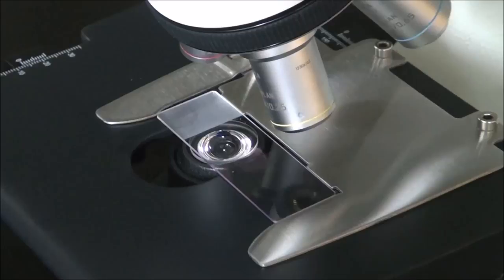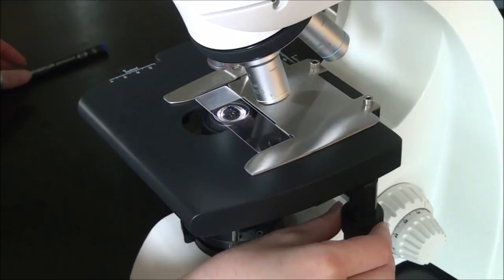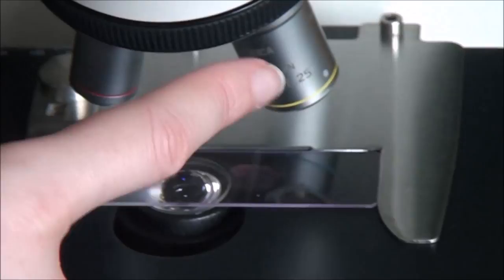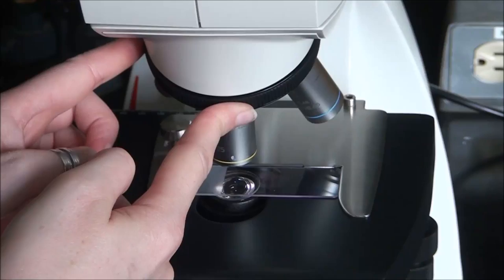Make an orientation mark on top of the slide with some felt, making sure it's not on top of our smear. We then want to double check that our mark on the slide is centered using our XY to put that mark in the very middle for the 10x lens. We don't grab the objectives; we adjust them by using the turret which has a black grip, and we want to really lock that lens into place.